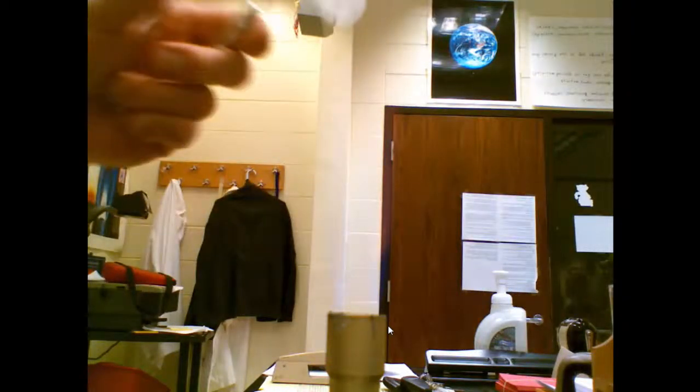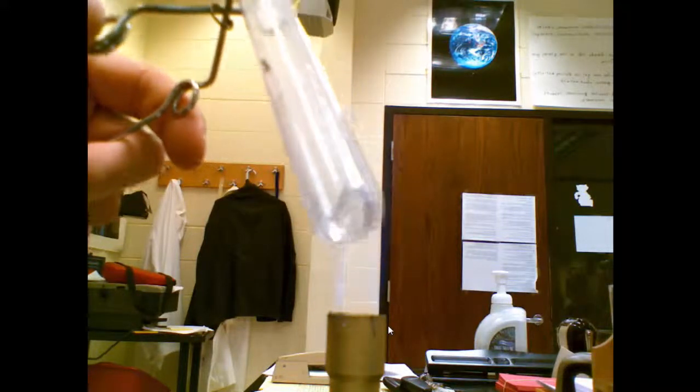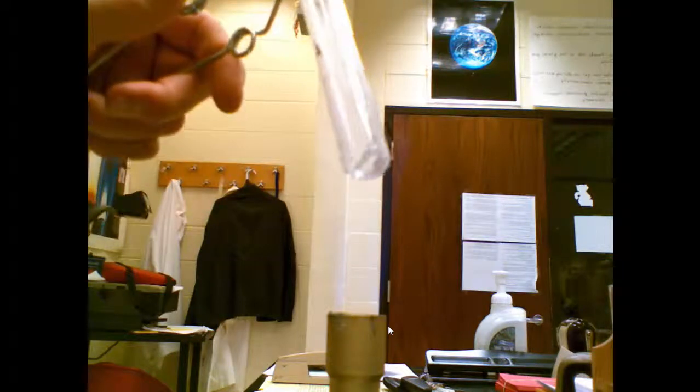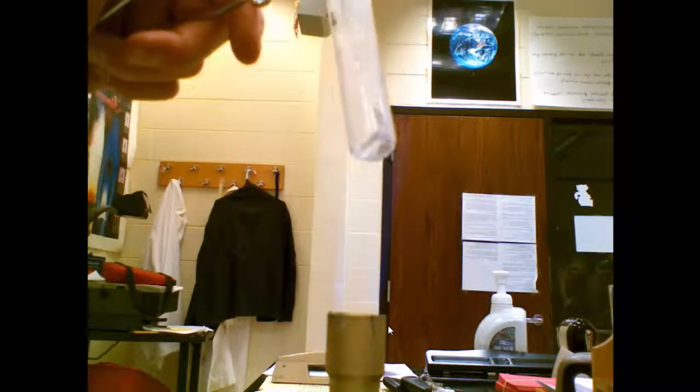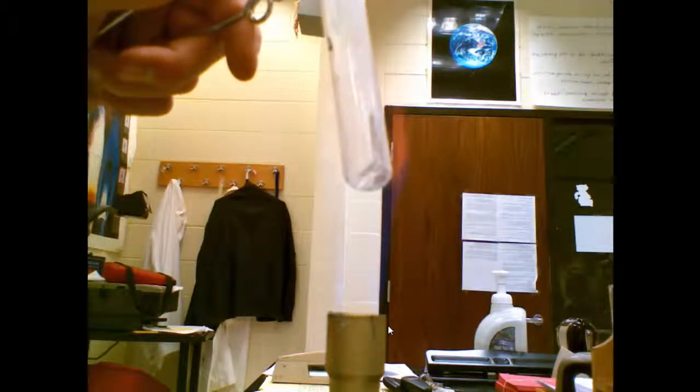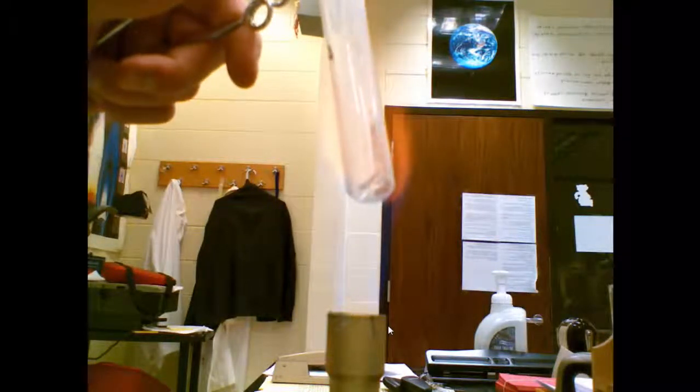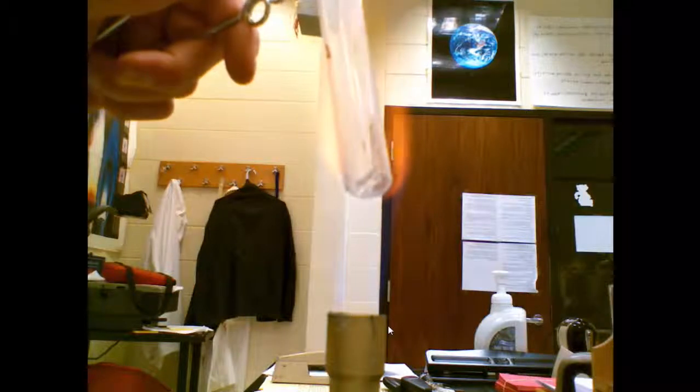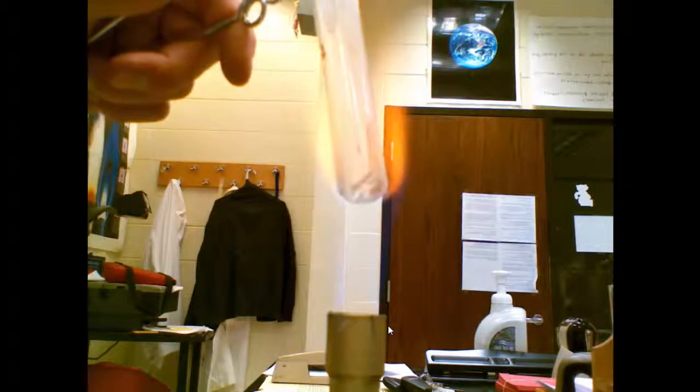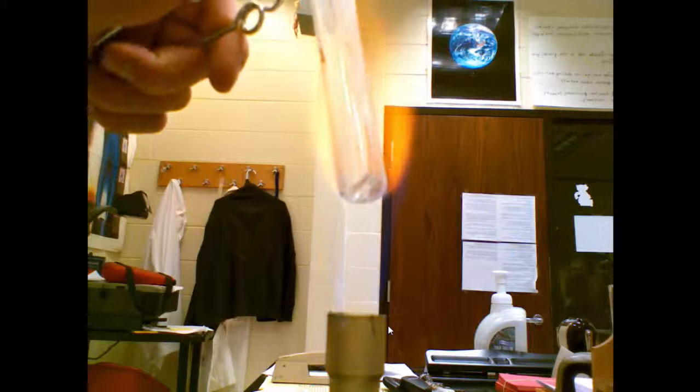Crystal number 10. This is a singular crystal, see-through so it's hard to see inside of the glass test tube. Okay, it's in the Bunsen burner. Flame is beginning to turn yellow. Still no signs of melting. The flame is definitely yellow. The sample has not began to melt. This indicates that sample number 10 cannot melt in our Bunsen burner.